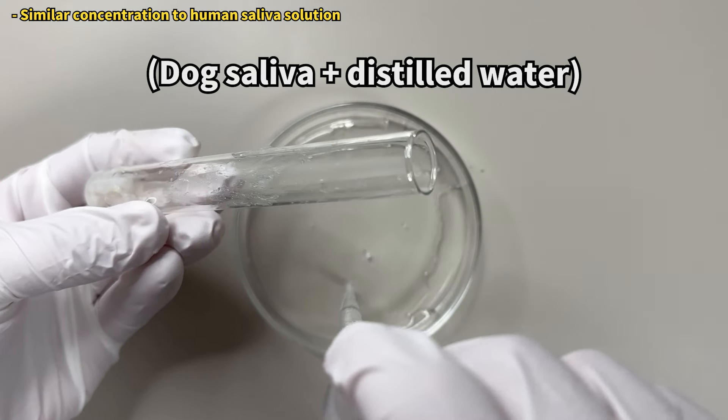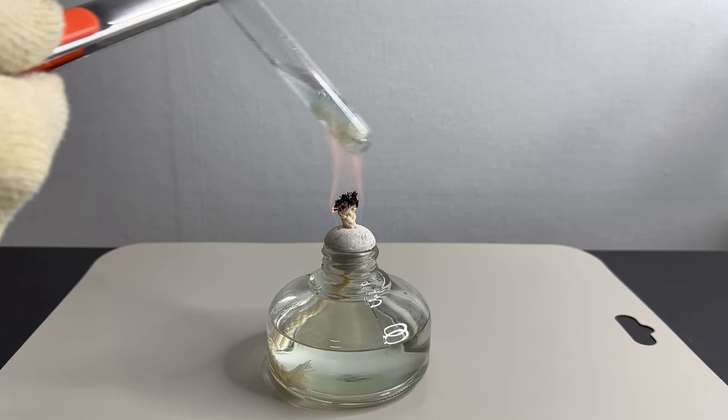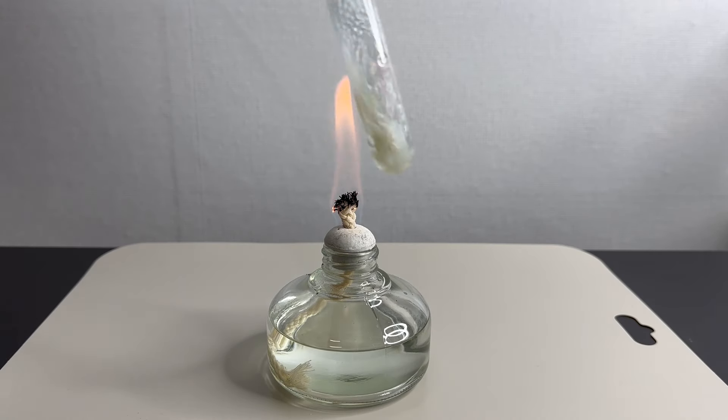Interesting, isn't it? Now, let's test the saliva from Prince Buddy. We mixed his saliva with rice grains, added Benedict's reagent, and heated it.